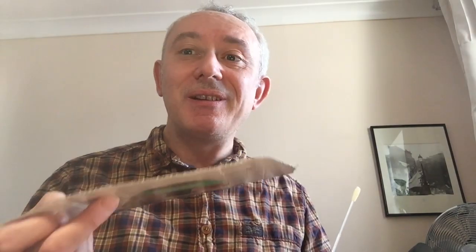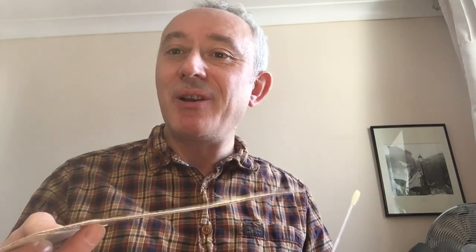Now with swab sampling technique — I'm going to use a surface here. This is a piece of cardboard from a cat food box, so it is not representative of a clean room, and cardboard is never allowed inside a clean room.